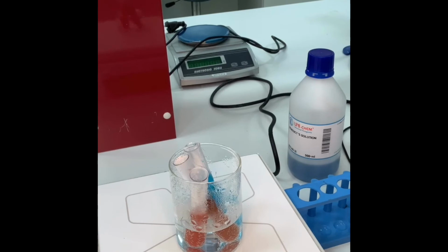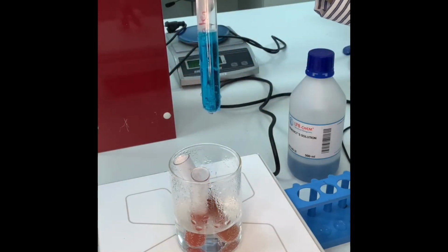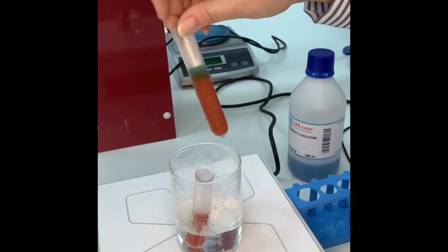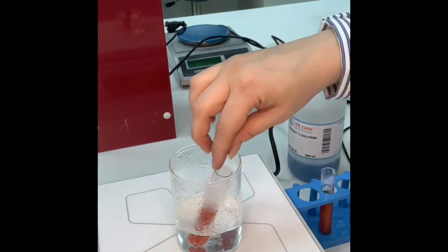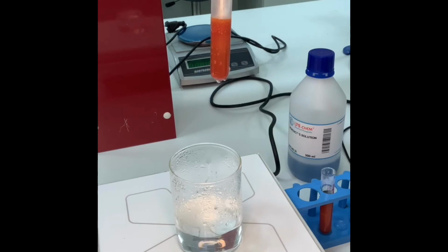Now look over here. This is the negative control for Benedict. This is the soda. I can't hold it, but I will show it to you right now. And this is the juice. It's an apple juice, basically.